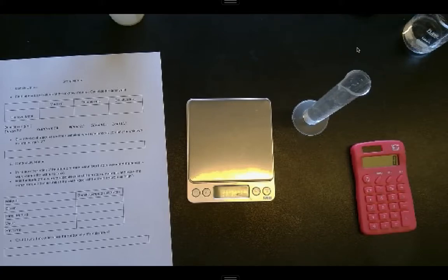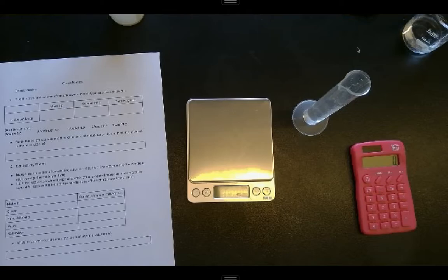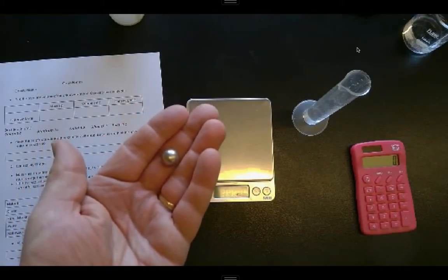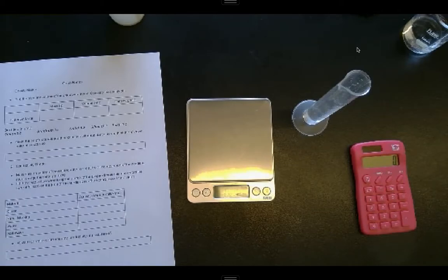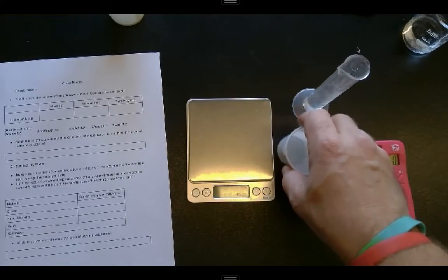All right, so we are going to run through our station lab today for the different physical properties. First one is just a simple density lab, and this is something that we're probably pretty handy at, but we'll run through the process as well. And what I have here is an unknown metallic ball, and I'm hoping to use my physical property to help identify what it is. I know that on my list of options, it's either silicon, aluminum, nickel, silver, or lead, based on what density I find, and we're going to try to make that determination.